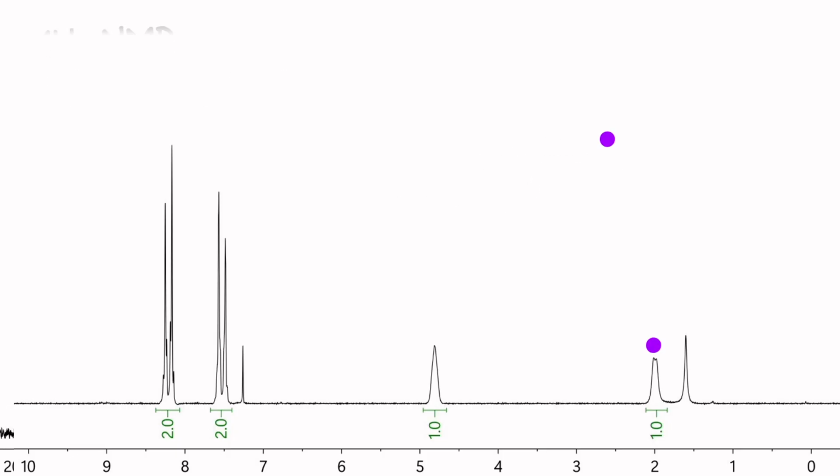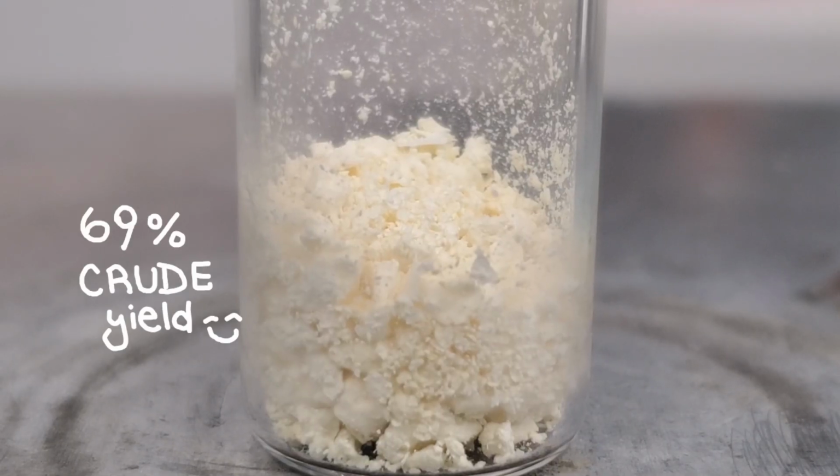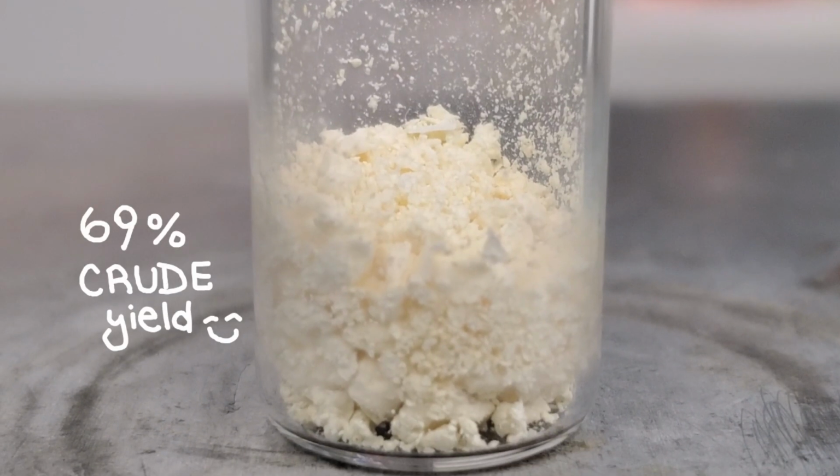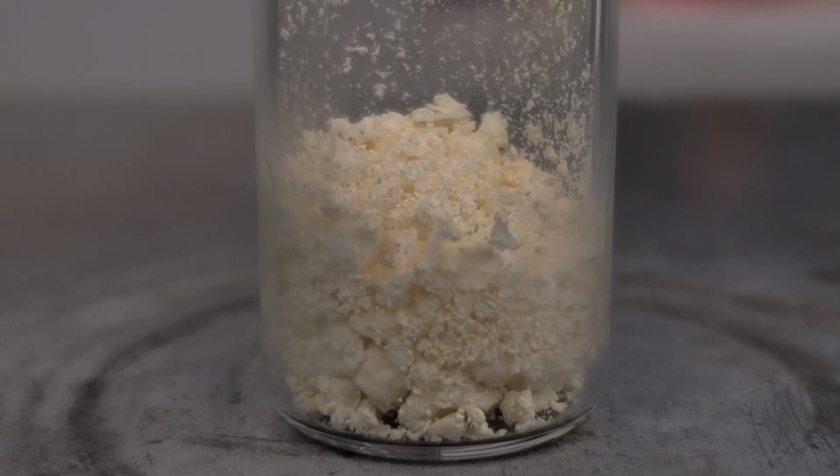solvent or acid workup. In the carbon-13 proton-decoupled spectrum, the benzylic carbon shows a signal around 60 to 65 ppm with subtle splitting and broadening compared to a normal CH2 carbon, again consistent with a carbon attached to a deuterium. This was a really satisfying reaction. Using deuterium this way is a powerful tool to prove or disprove a proposed mechanism.